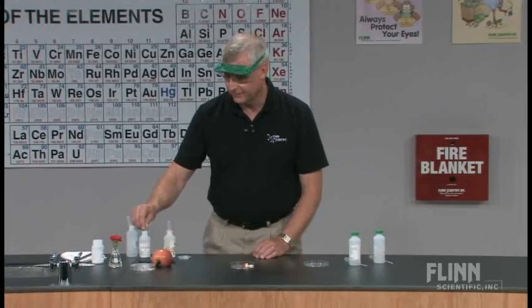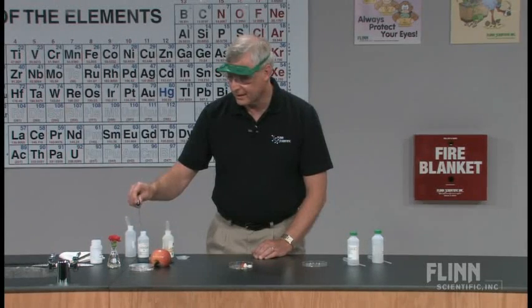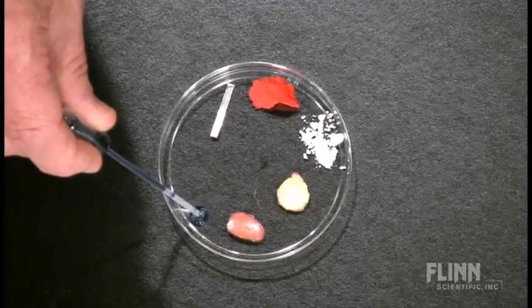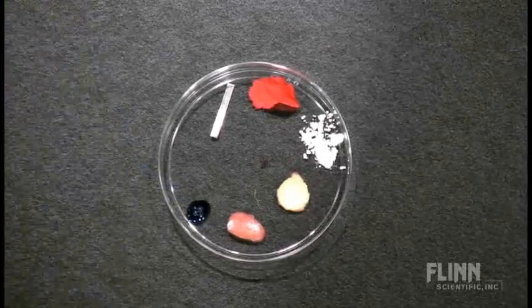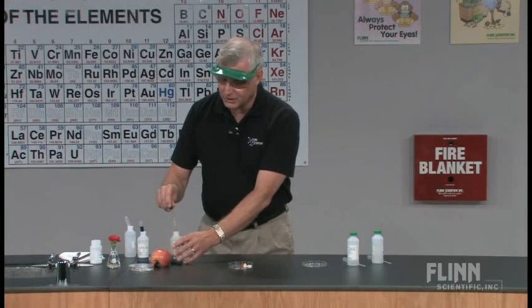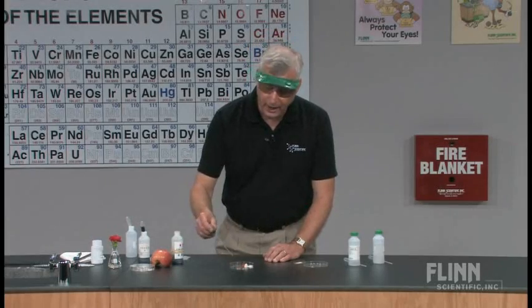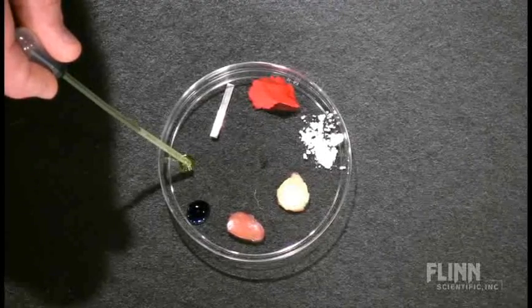Then we'll put a couple of indicators. I'm going to use a small amount of bromothymol blue. Bromothymol blue is blue in the base, and it will become a yellow color in the acid. We'll also put our universal indicator solution in there. Students by this point would have done a number of labs with universal indicator, so they would understand that green is the neutral color, red-orange would be the acidic color, and blue-purple would be the base area. So we'll place just a couple of drops of that in there as well.